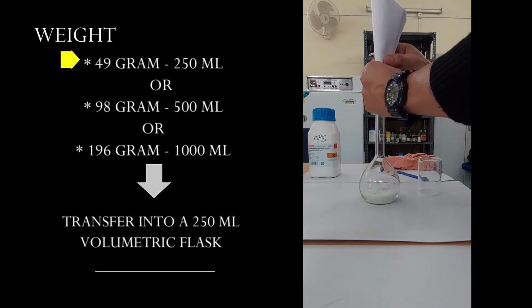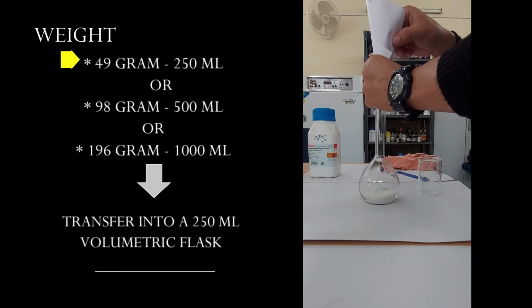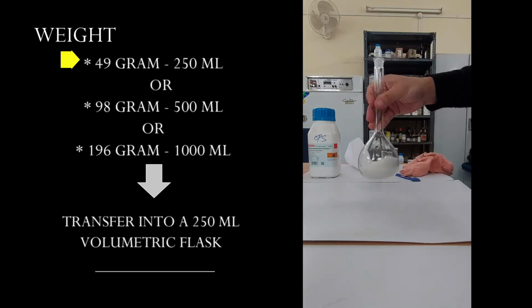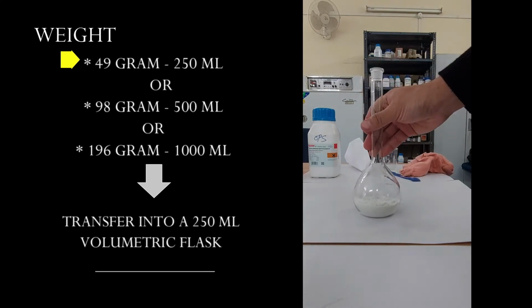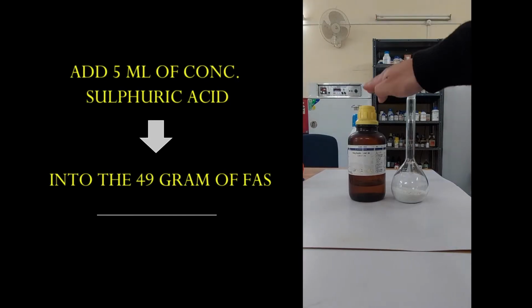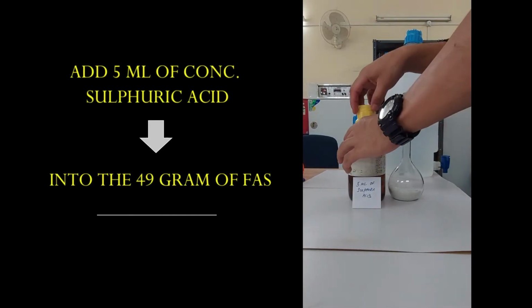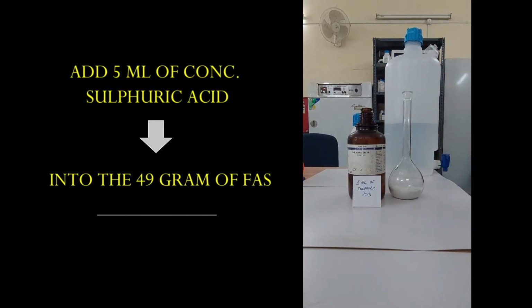After transferring the ferrous ammonium sulfate into a 250 ml volumetric flask, the next step is to add 5 ml of sulfuric acid into the 49 grams of ferrous ammonium sulfate.